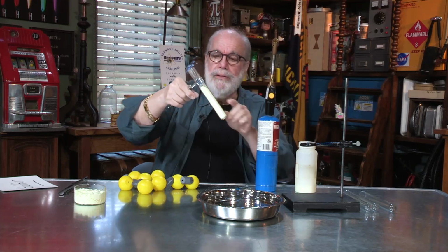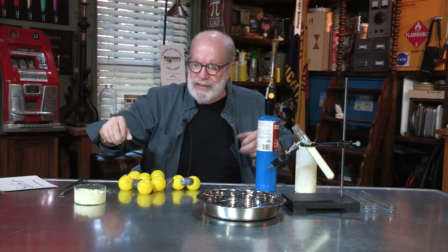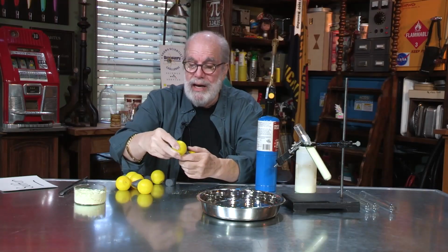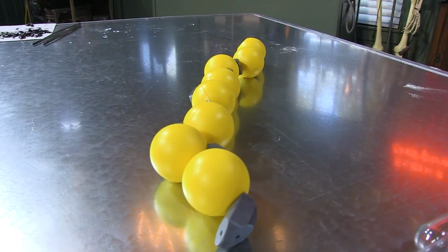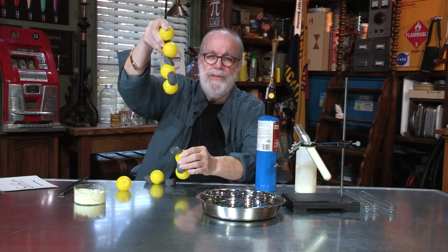And the way I'm going to do that, I'm going to heat up the sulfur and it's going to melt. And that means that these molecules, the S8 bonds, are broken. So those molecules are going to be moving around real fast because I heated them up. And then I'm going to stop them right where they're at. Now, slow down. I'll have you think, how could I slow those back down? Duh, you cool them off, right? And if things work out, I'll get a nice long chain of them. And if I could lock them in place like that, I'd have long chains, maybe hundreds of these long.